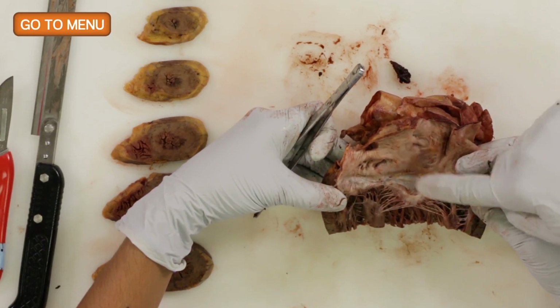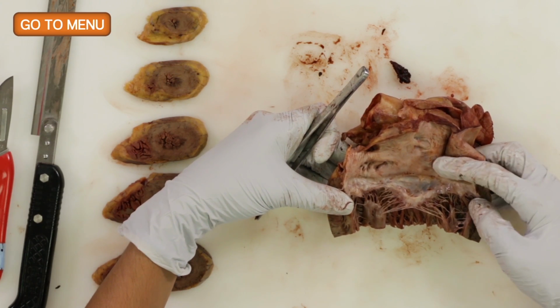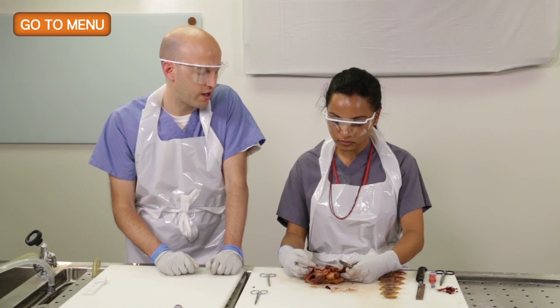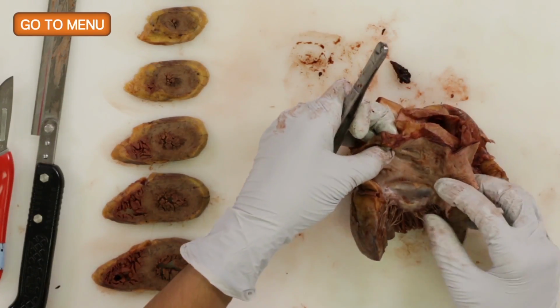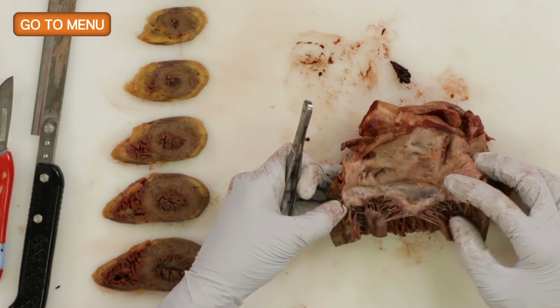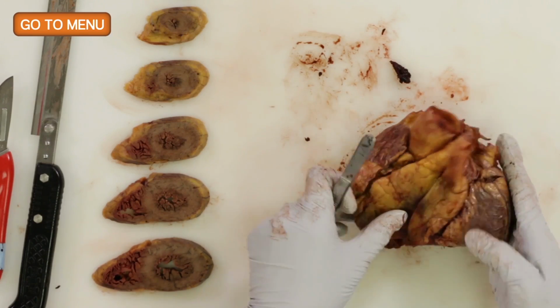And you can see the area of the septum, the atrial septum, and we're not able to see the ventricular septum anymore, but this is where an atrial septal defect might lie, and this patient does not have that. You can also look for a patent foramen ovale in this case. You don't have a probe, but you would look here in this area. So that's okay.